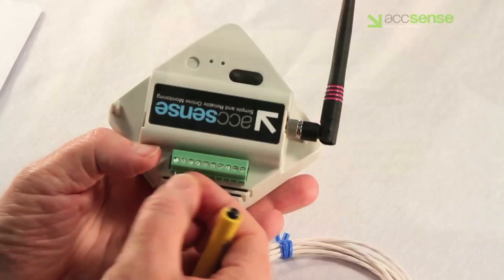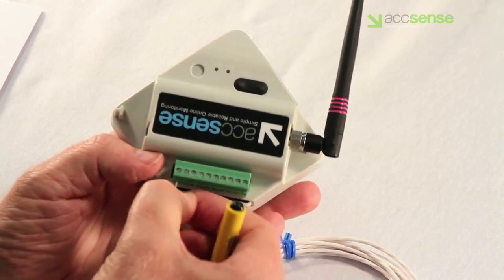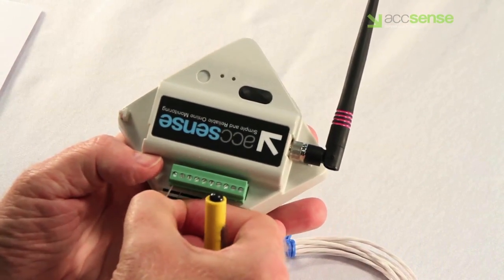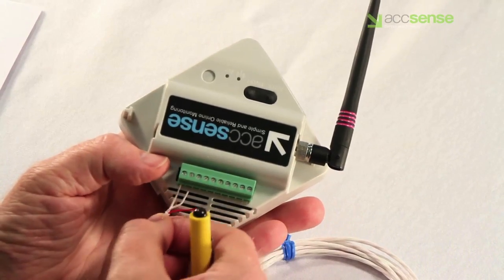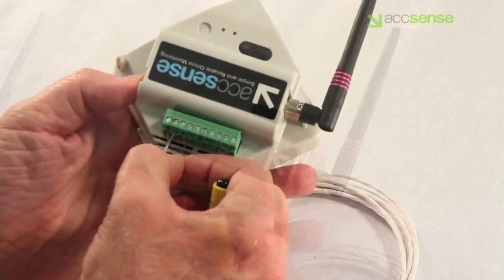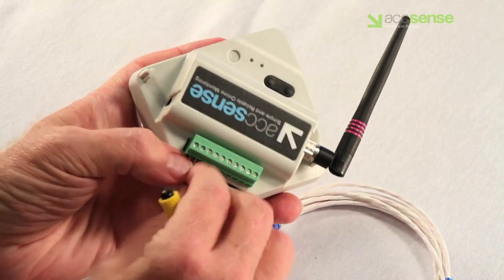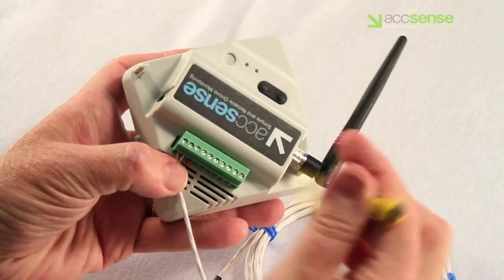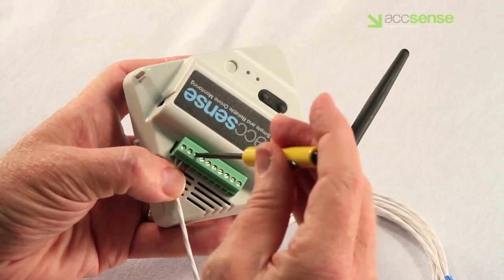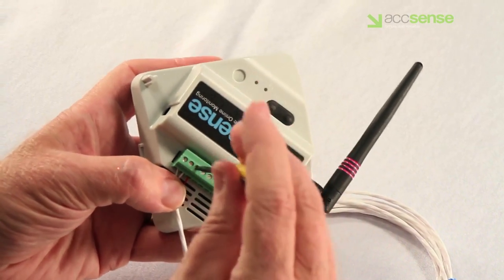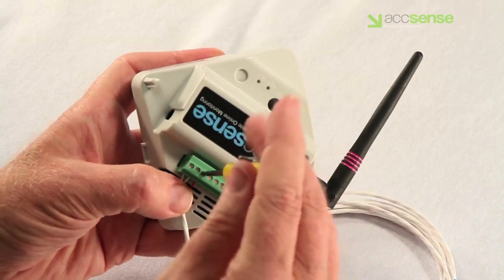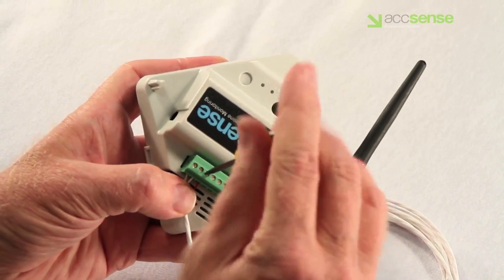Insert the second white wire at pin two and tighten as before. Insert the uniquely colored wire, which is normally the red one, at pin number three. This is the negative connection. Tighten it as described before.